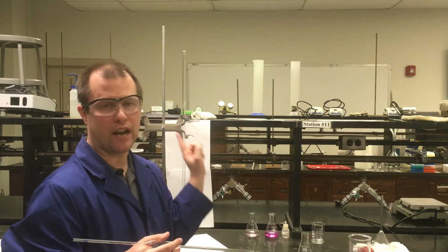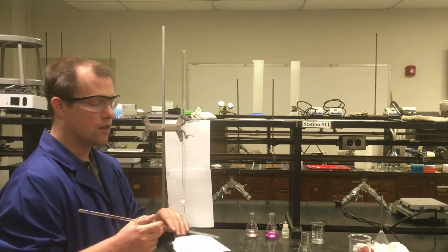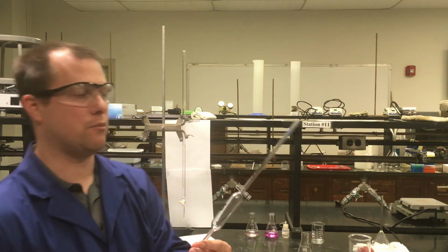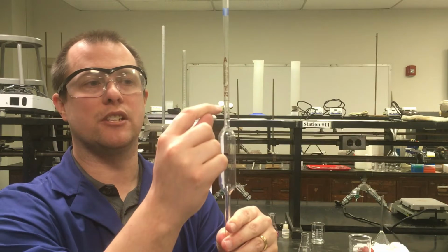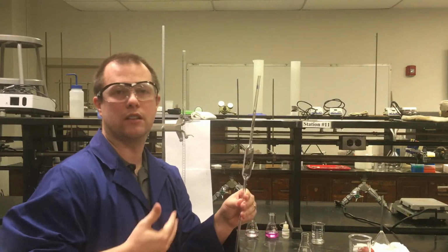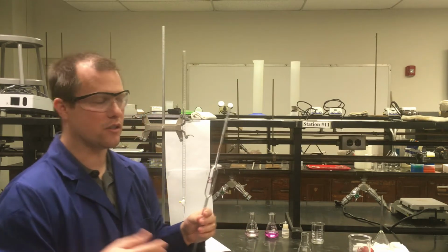Because everything else we're going to find is based on moles, so the volume is the other piece that will let us get our concentration that we need for the Ksp itself. So to measure the volume, we're going to use something called a volumetric pipette, and that's what I'm holding here. This is a 25 milliliter volumetric pipette. It's got a marking on it right here. If we fill the liquid level in this pipette exactly to that marking, we have really accurately exactly 25 milliliters for our volume. Much more accurate than, say, a graduated cylinder that we might use otherwise.